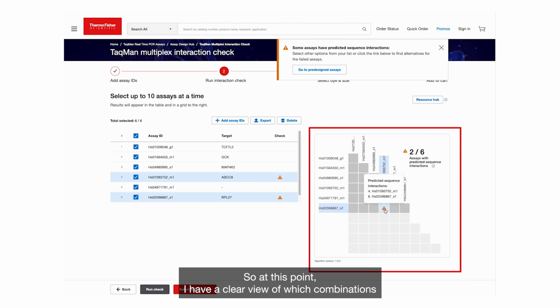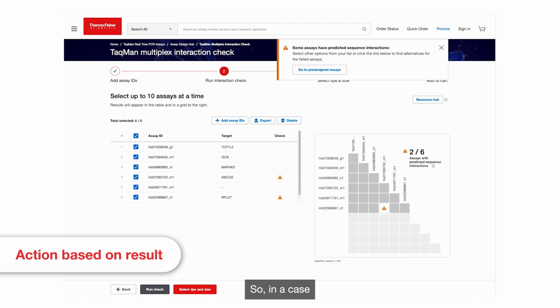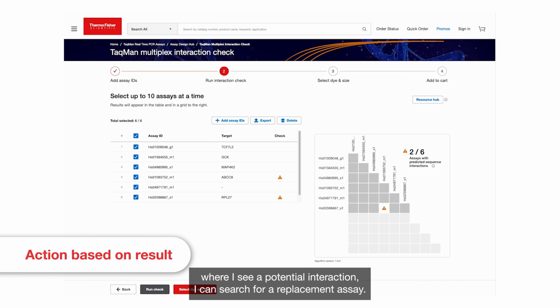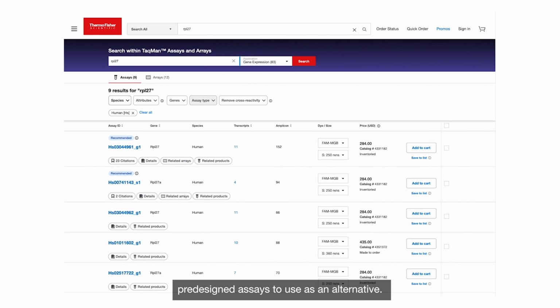So, at this point, I have a clear view of which combinations may cause issues and which ones look clean. This helps me decide how to move forward before running any experiments. So, in a case where I see a potential interaction, I can search for a replacement assay. I can quickly review available options from the TaqMan pre-designed assays to use as an alternative.